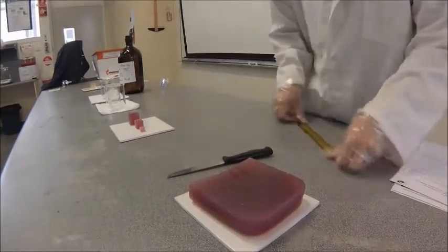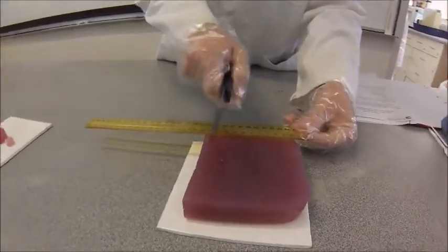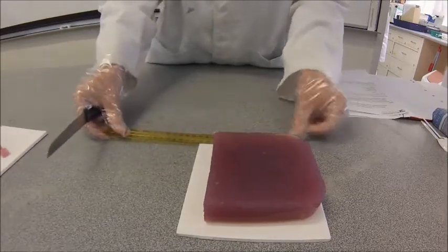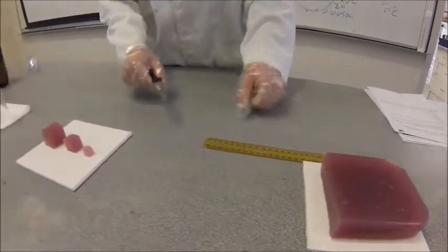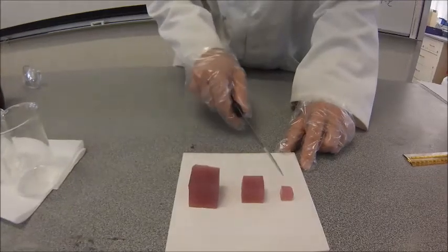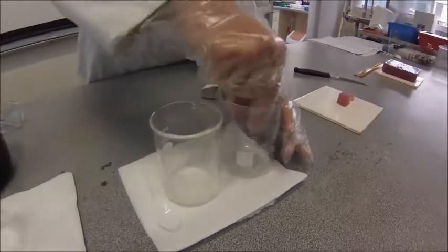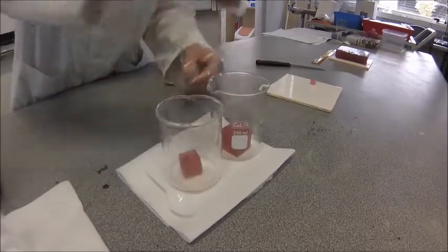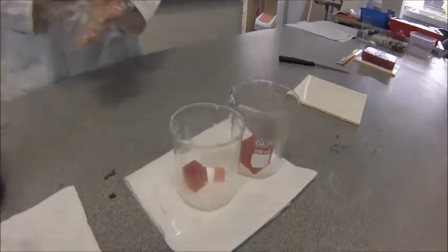For the very first step, we have our agar block, provided with a tile, a knife, and a ruler. You're going to measure using the ruler and cut a strip that is three centimeters wide, then divide that into the cubes you require. You'll have plenty of material to work with, so if you don't get it right the first time that's okay. We have some prepared already — a 3cm cube, a 2cm cube, and a 1cm cube.